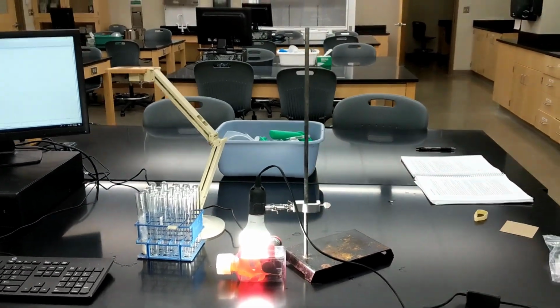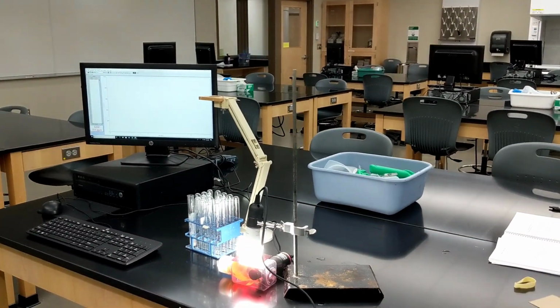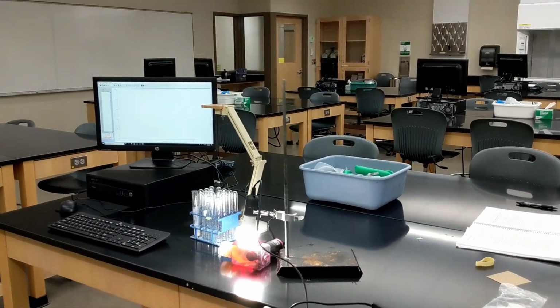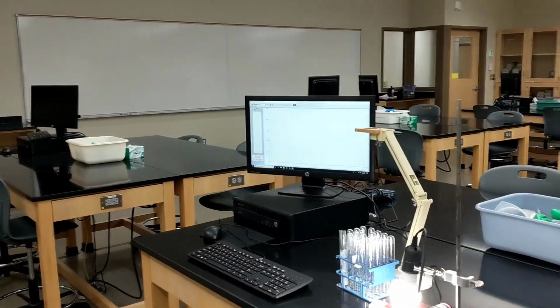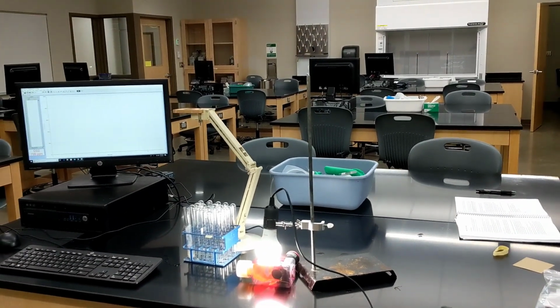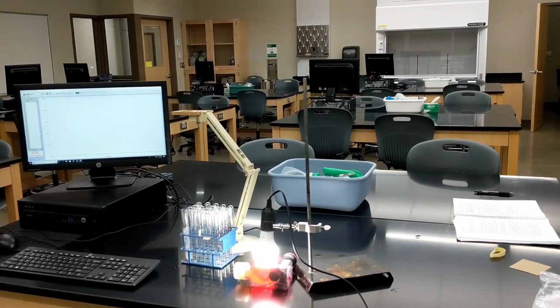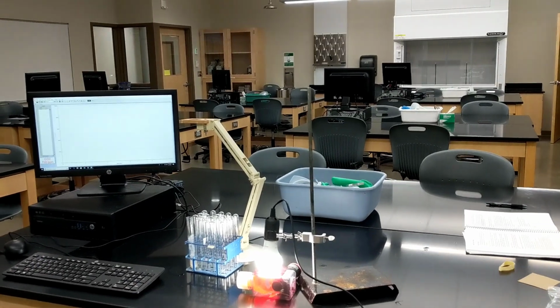So you would want to make some hypotheses. First of all, what should carbon dioxide levels do if the plant is photosynthesizing? Something to think about. And what we would do in class then is we would try white light, red light, blue light, green light, and darkness to see what photosynthesis does in each of those conditions. More importantly, we'll see what carbon dioxide levels do in each of those conditions.